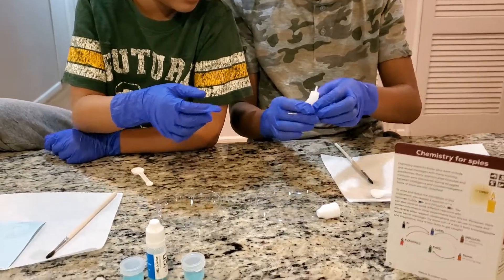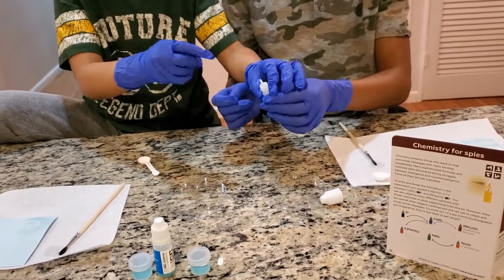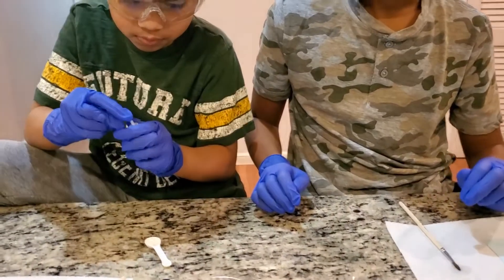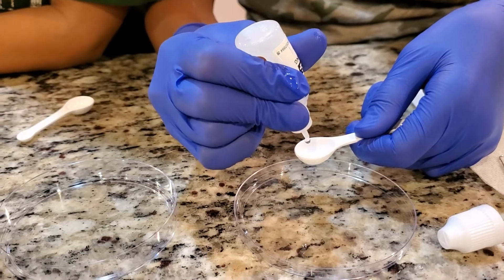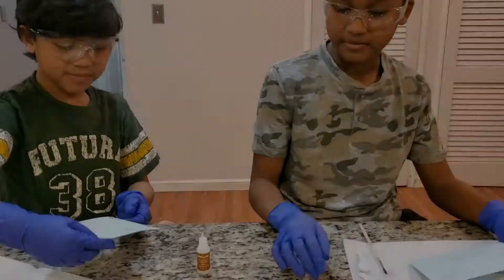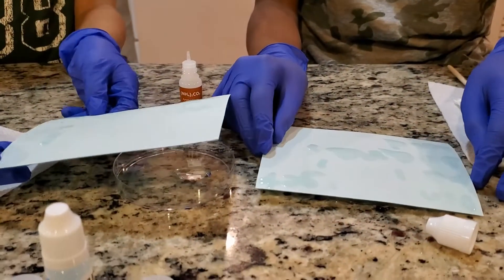I don't know what they're called. I'm going to put it in a big spoon. I don't know what it is. Now we're going to put the secret messages. You can probably see them.